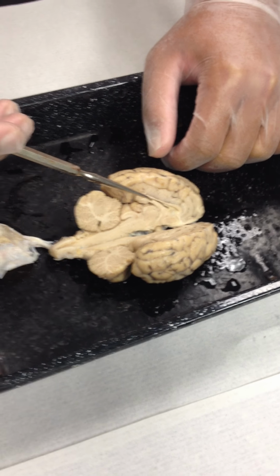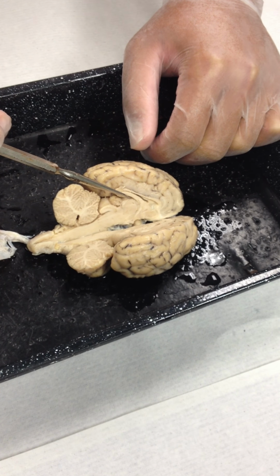Okay? So she's struggling with this one, she should have kept it with the other one, all right?